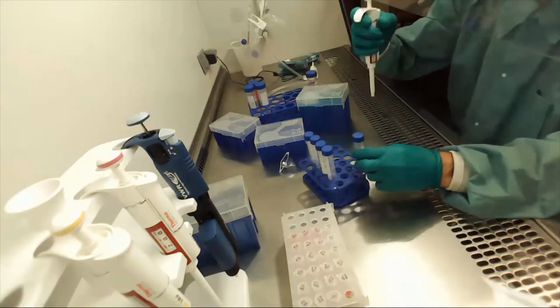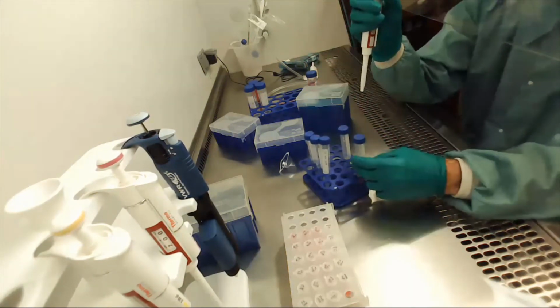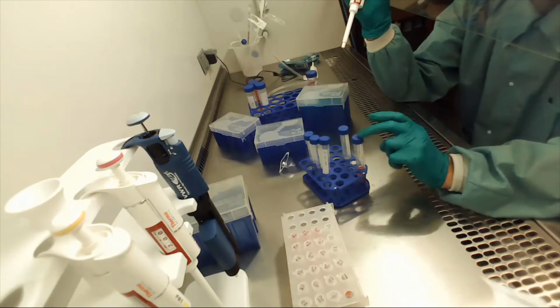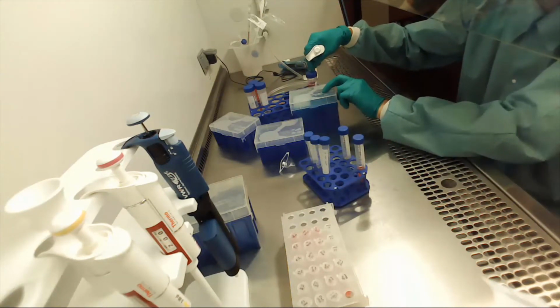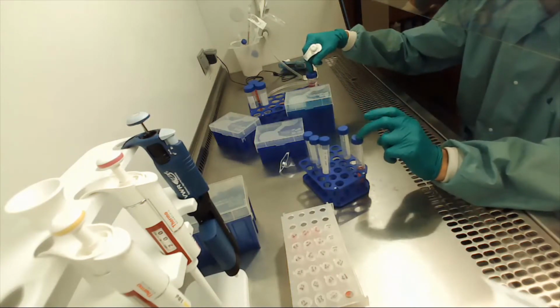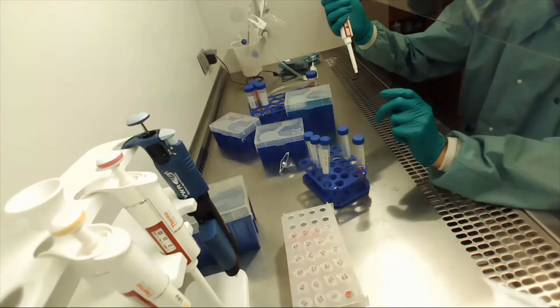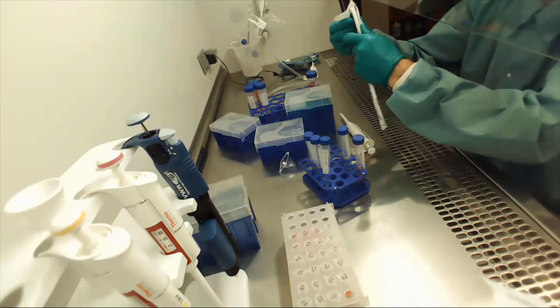Okay, and now I need to take, from my math, to go from 27 to 22.5, 4 mils of this, and I need to add 1 mil of this. Which, okay, so this is 4.5, this is 27. If you do 4 times 27 plus 1 times 4.5 divided by 5, you'll get 22.5. Okay? So I'm going to go ahead and use this one to get the 4 out.